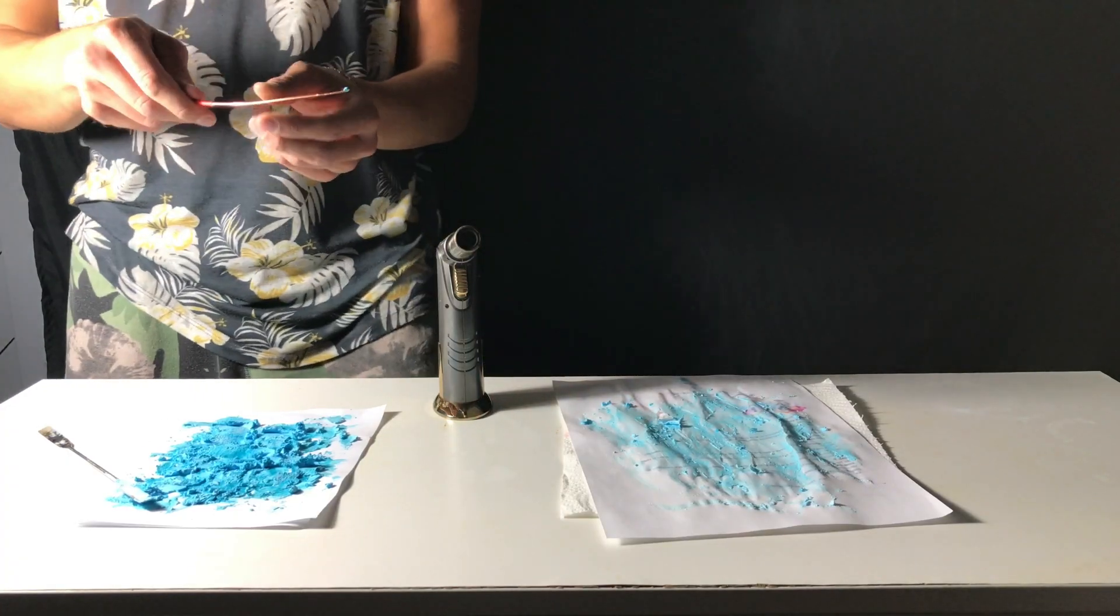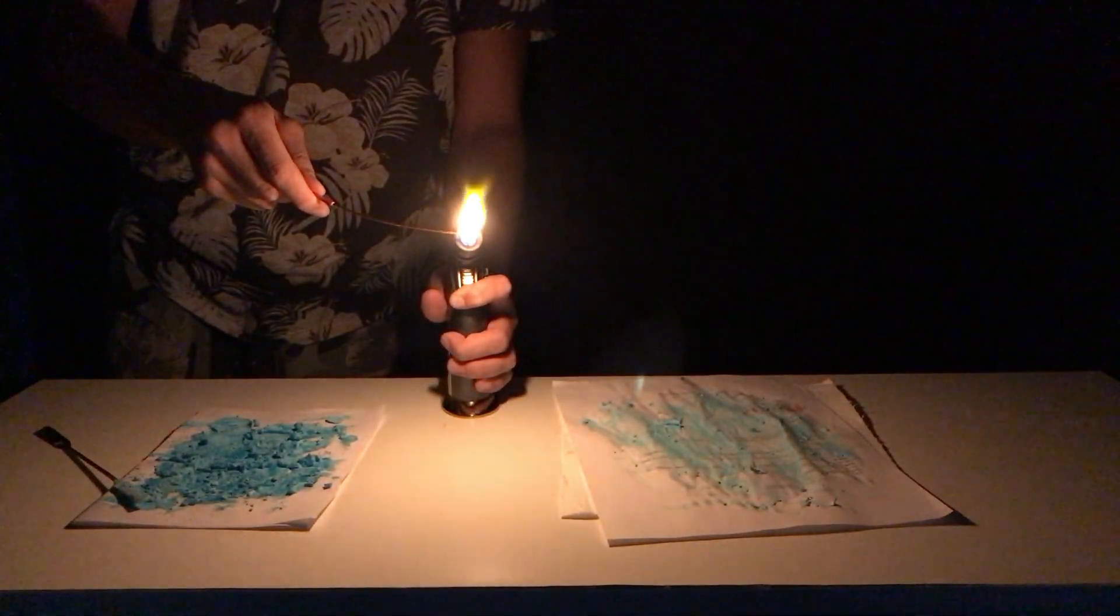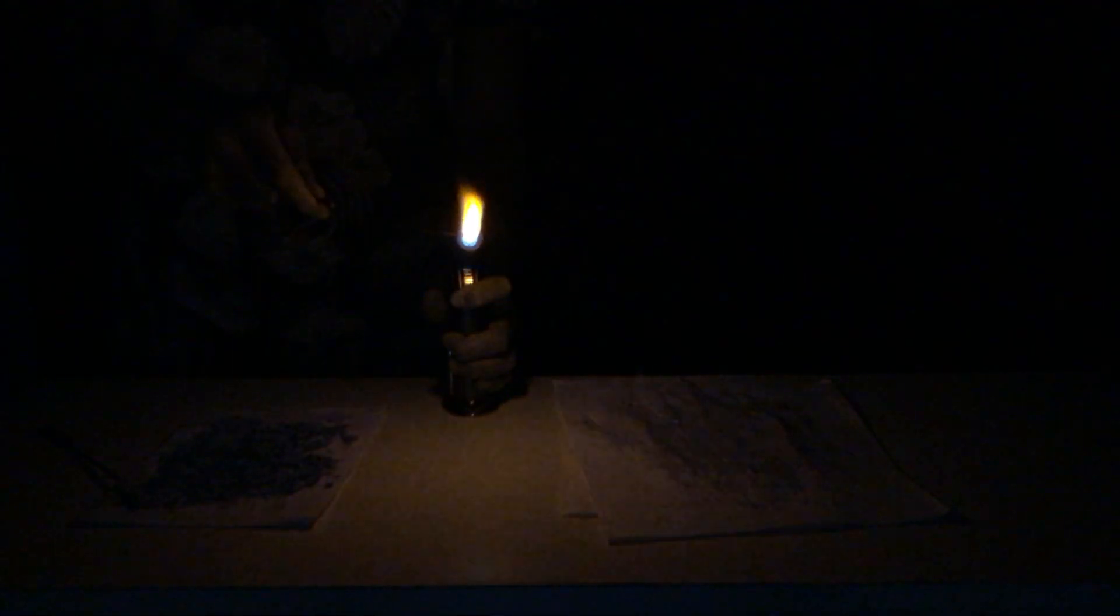While still waiting for our product to dry, I performed the flame test with our unpurified copper benzoate and also with our purified copper benzoate. You can see that the flame test reveals that our unpurified product still contains a lot of sodium.